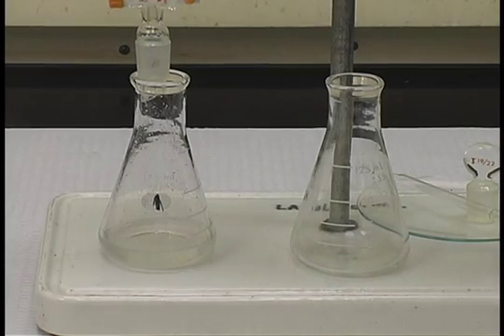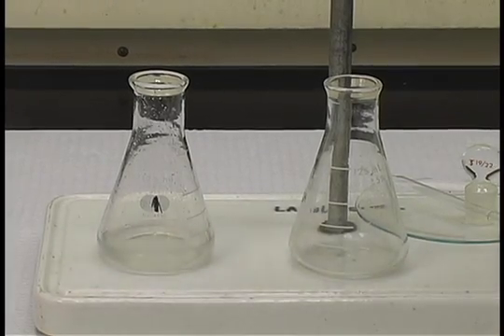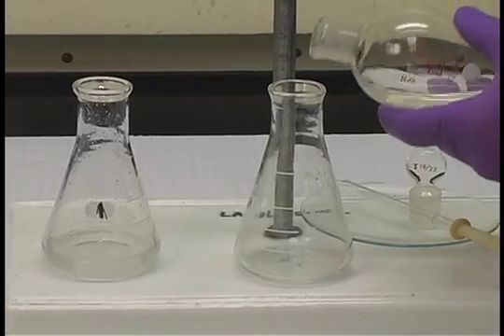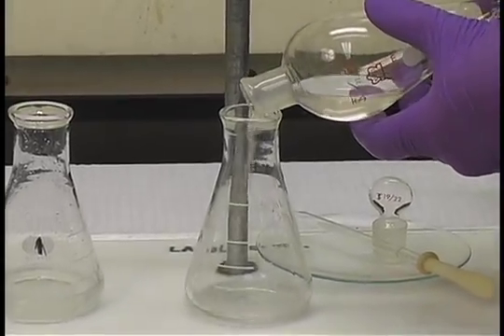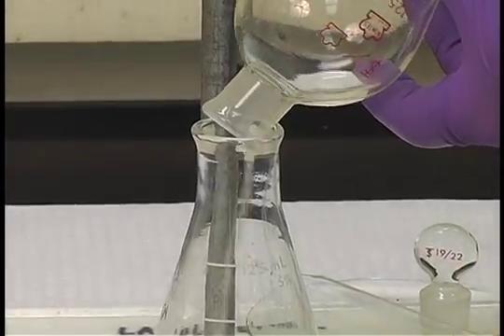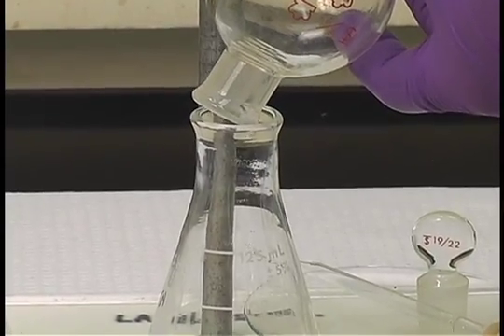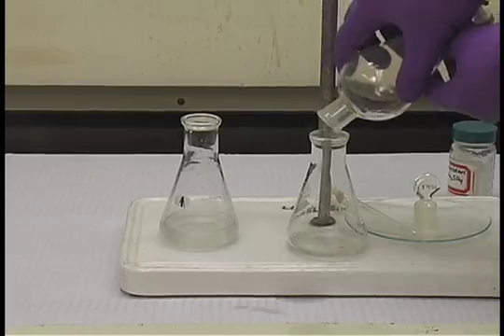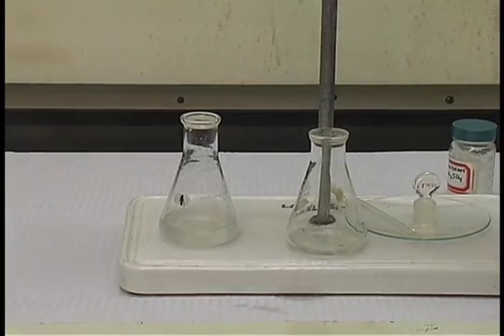The top layer, in fact, is removed by pouring it through the top of the separatory funnel. Remove the separatory funnel and simply decant the liquid into the flask. And so we've now separated the two solutions.